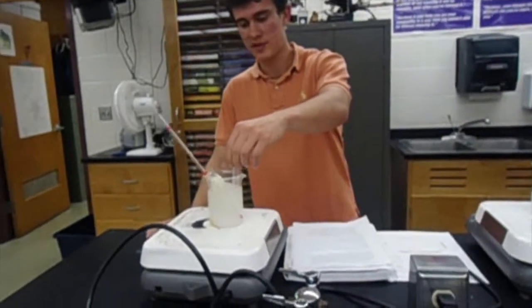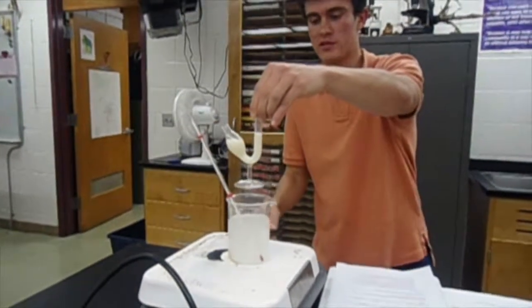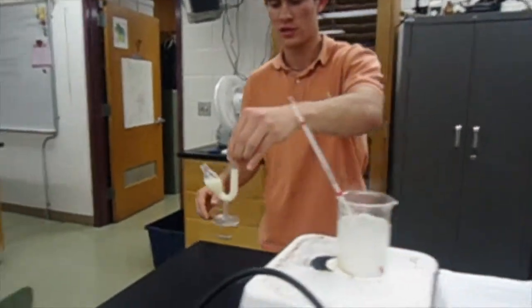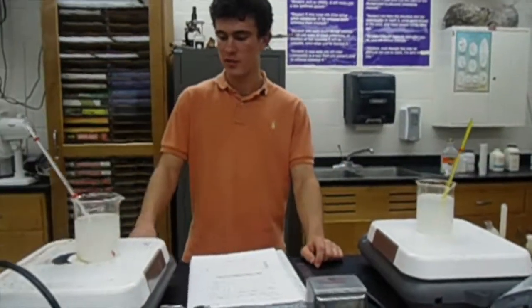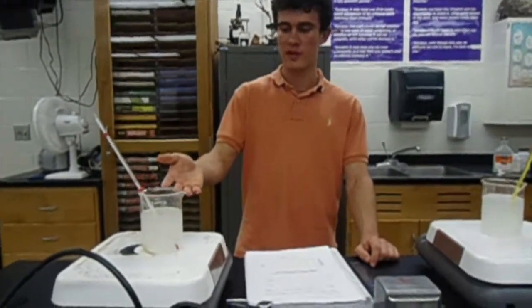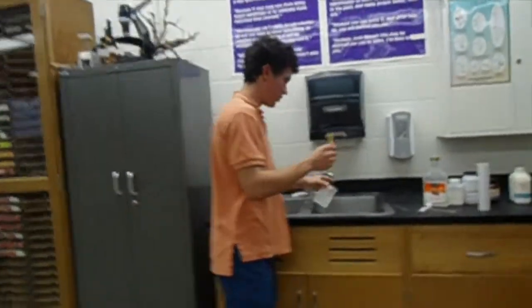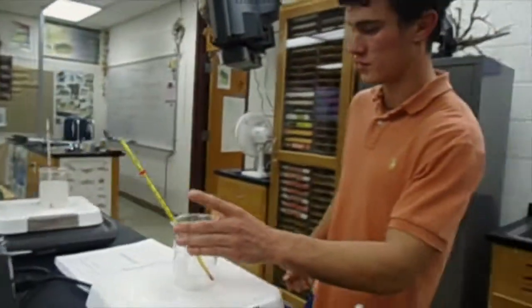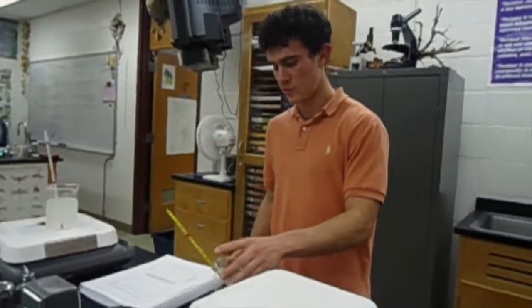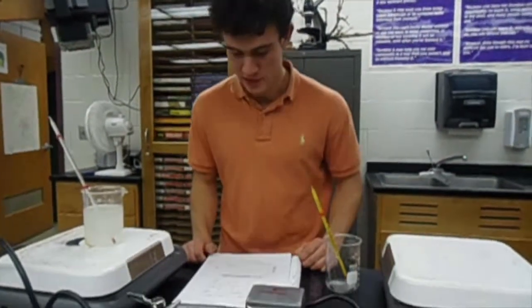Now that the lab is done, be careful with this one, it's hot. Just be careful with the hot plate. When you're all done, go to the beakers, take out the fermentation tubes, and set them over there. Make sure your hot plates are turned down. Here, this might be a little bit hot, so just be careful. You just pour it out, and keep going around and doing that with the other ones. Just clean up your lab, and then you can sit down with your teammates or by yourself and analyze the results.